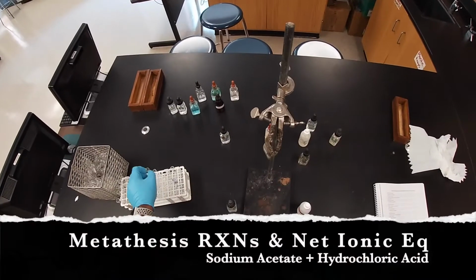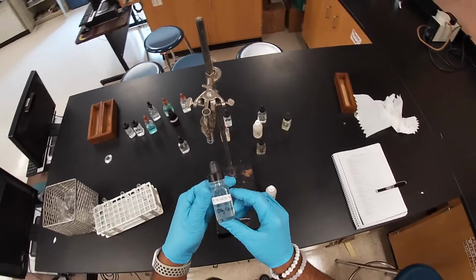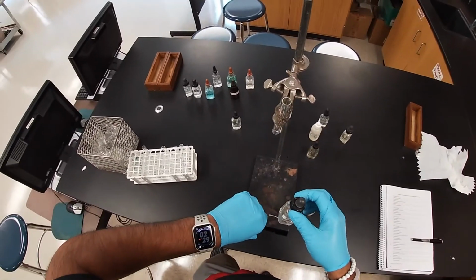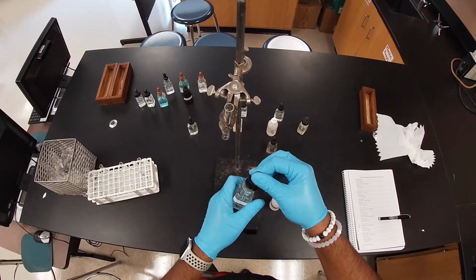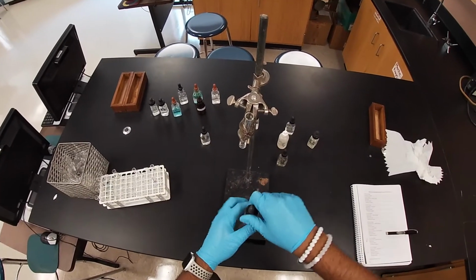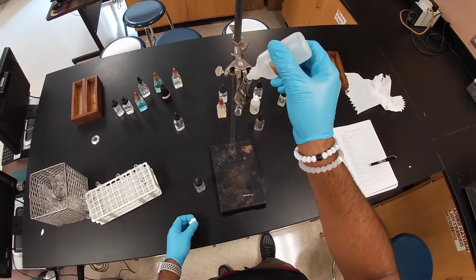In our next reaction, we're going to have a reaction of sodium acetate. So we'll get our test tube set up. Here we have sodium acetate, and then we're going to react it with hydrochloric acid. So let's go ahead and get some sodium acetate. Put in our dropper full, and then we'll close it, and we're going to get some hydrochloric acid and put it into our sodium acetate.